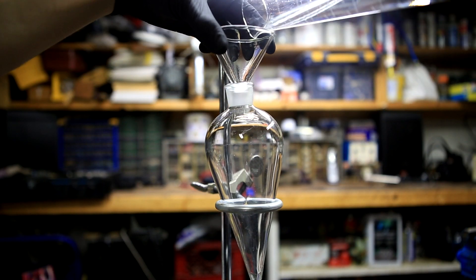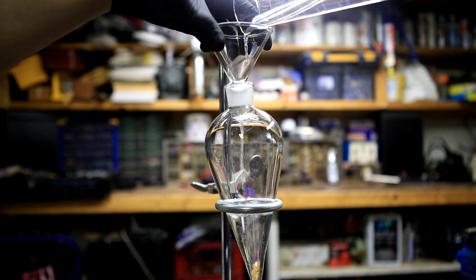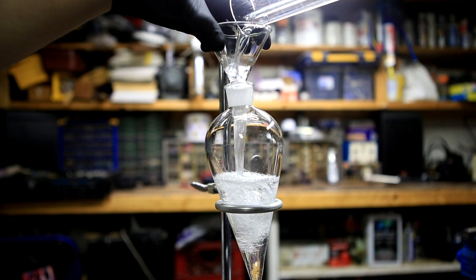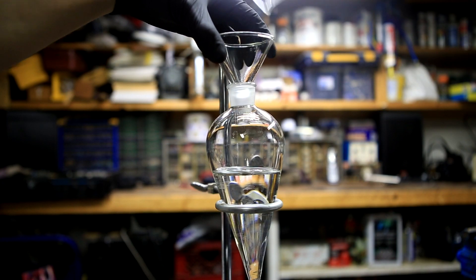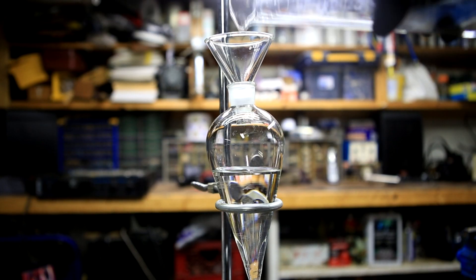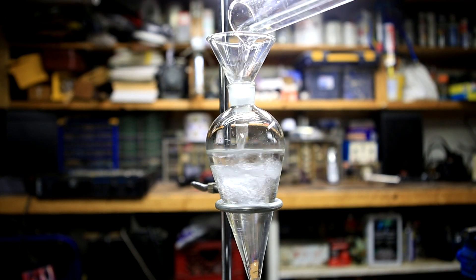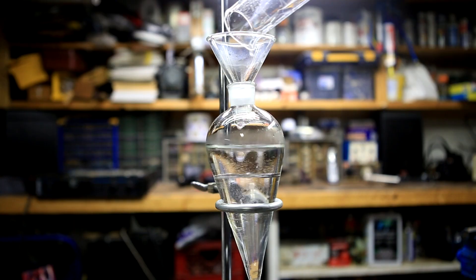I don't have anything larger than a 250 ml separatory funnel, so I did this in 130 ml batches. So first, 130 ml of DCM was added to the separatory funnel. I washed the methylene chloride layer twice with 75 ml of distilled water.